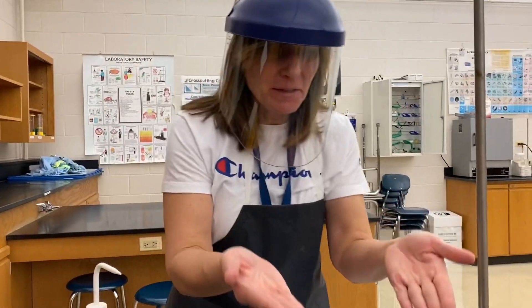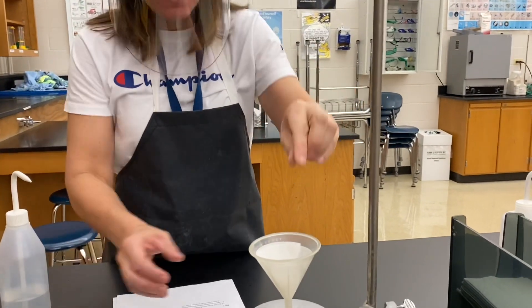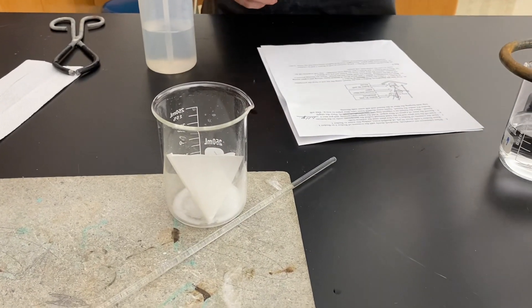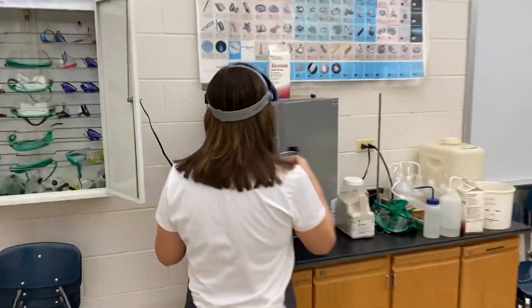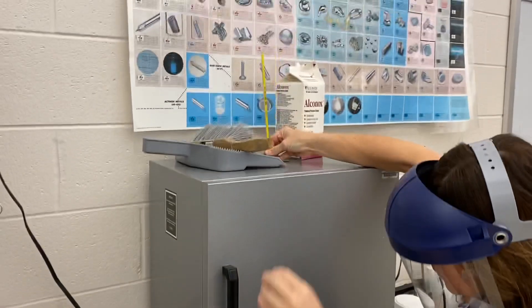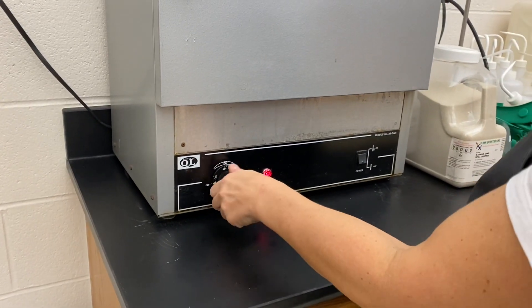Filtration is complete. Moving on to steps 11 and 12: I'm going to remove the filter paper from the funnel and set it into beaker one. Beaker two contains anything that was dissolved in the double replacement reaction — the soluble substance is dissolved in the water. The solid substance is in beaker one. I'm going to take these and move them to the drying oven — a gray box — turn it on, and crank up the heat because there's a lot of water in there.